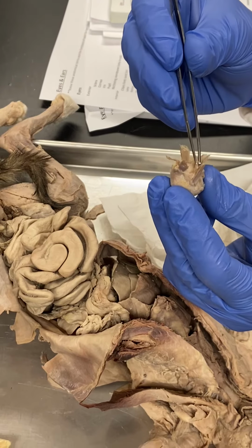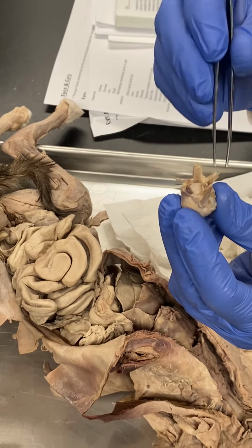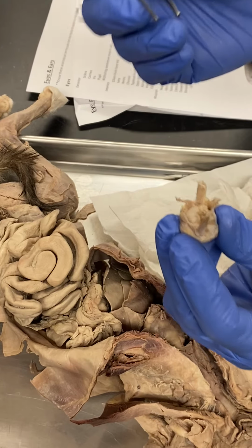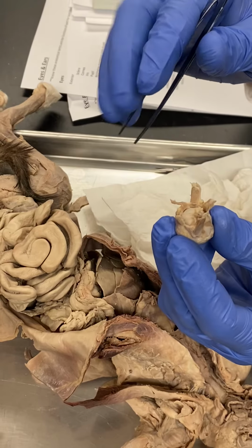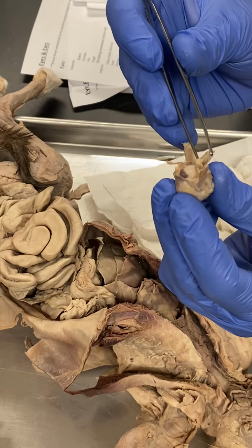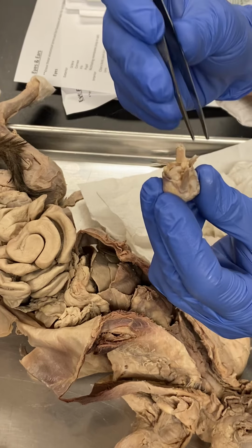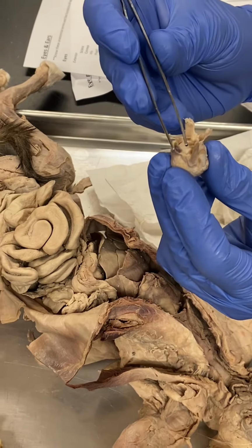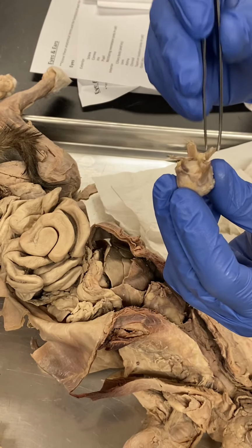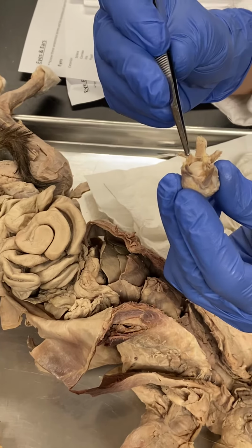Now, based on the dorsal muscles being up top and the ventral muscles being down here, you need to now locate and pinpoint the oblique muscles. The oblique name just means crossing over or angled, okay? And the oblique muscles go from lateral to medial in their orientation. This muscle is an oblique muscle. It's crossing over, going from lateral to medial. That makes this the lateral rectus, the medial rectus, the dorsal oblique, the dorsal rectus. Then we have the ventral oblique and the ventral rectus.